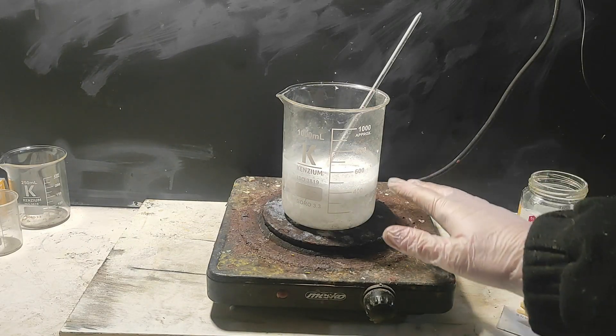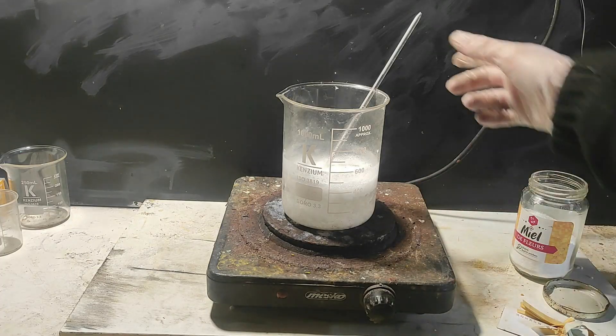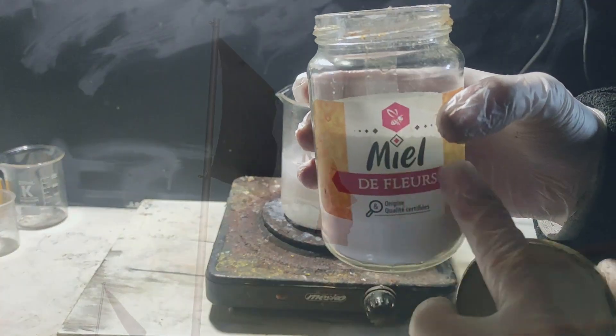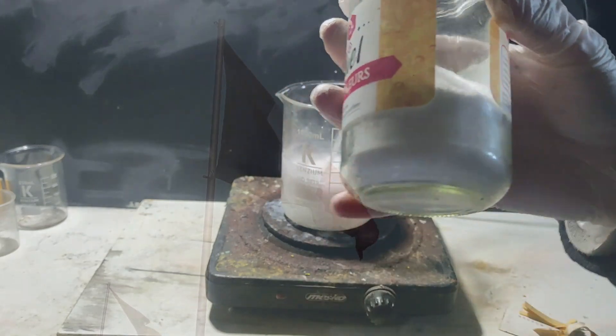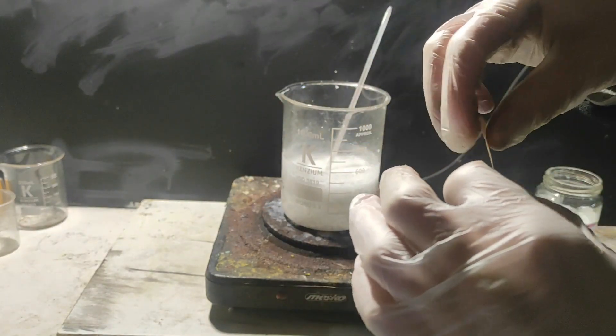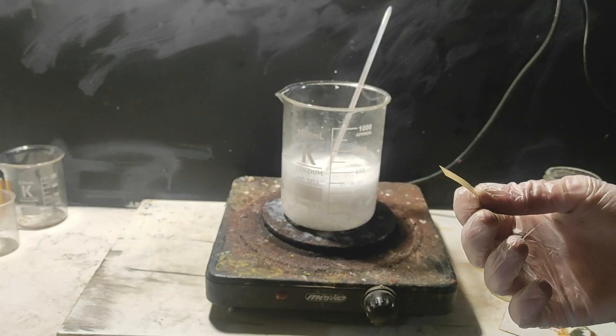It's not soluble though, so it will stay as a suspension. My honey, this is honey in French, my honey bottle of sodium carbonate. I've put the beaker on the hot plate and start heating lightly. This will help for the reaction.